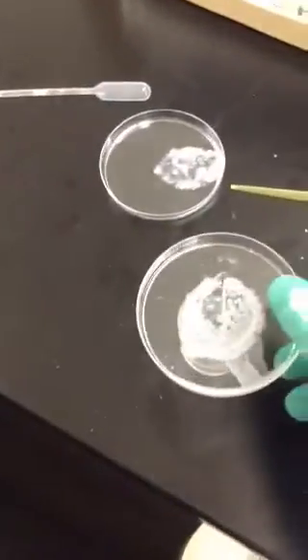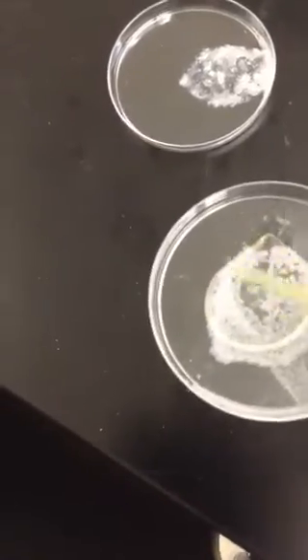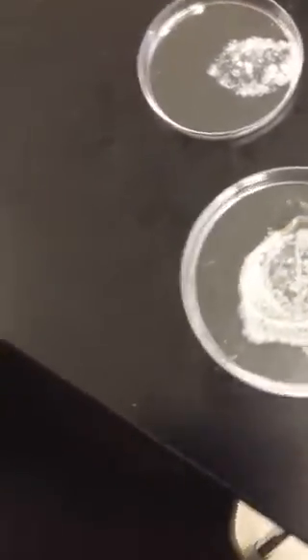Same at room temperature, more glass-like here. It's crystalline formation. Some crystals being formed, but more glass. And then here, almost solid crystals formed. Almost no glass, but solid crystals. Yes, crystals formed here, but they're much less defined than in the other scenarios. And if we poke it around, we'll see that it is in fact solid, although it looks like ice.